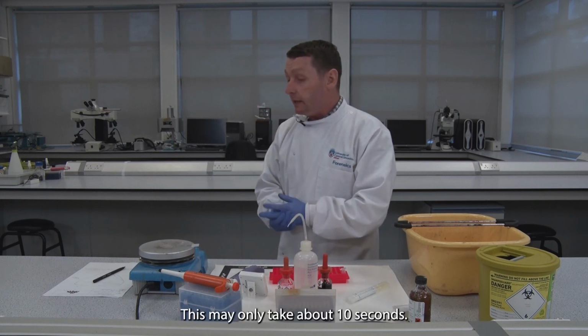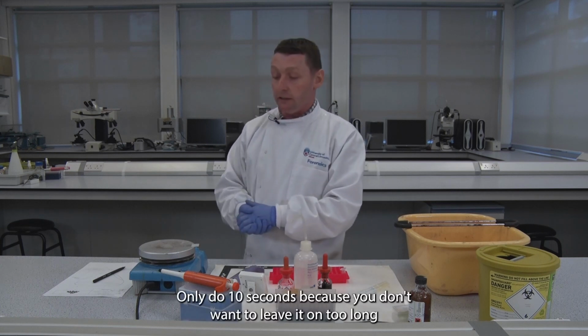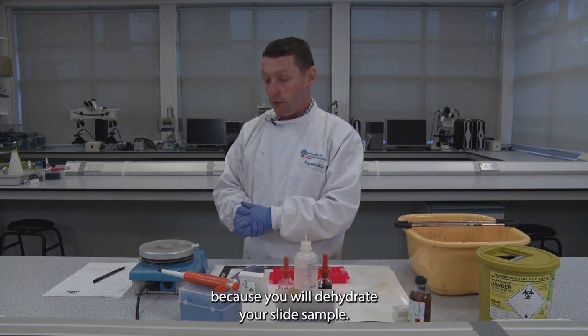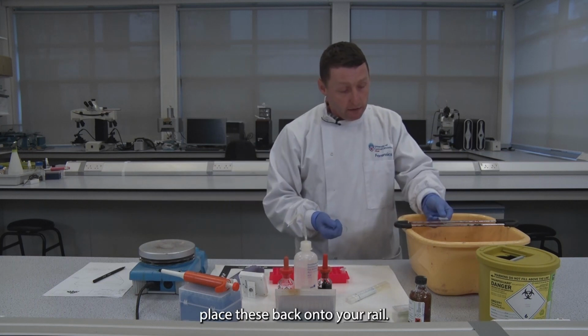This may only take about 10 seconds. Caution here, only do 10 seconds because you don't want to leave it on too long, as you will dehydrate your slide sample. Once the water has been removed, place this back onto your rail.